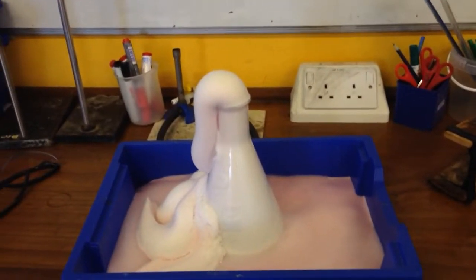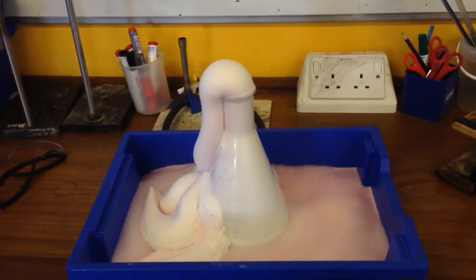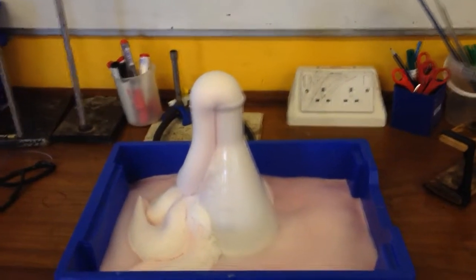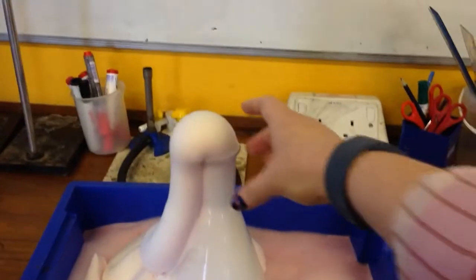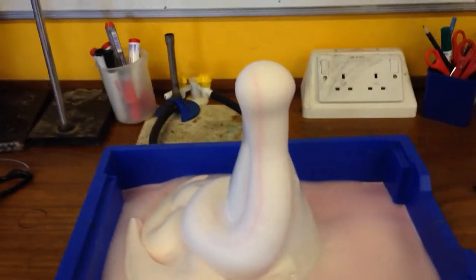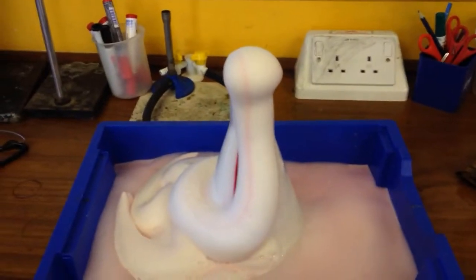This is an excellent reaction — an example of an exothermic reaction, of an enzyme-catalyzed reaction, and this is also a really good example of lava flow in volcanoes, which is what we were looking at. I can see a bit of a stripe coming out for my toothpaste.